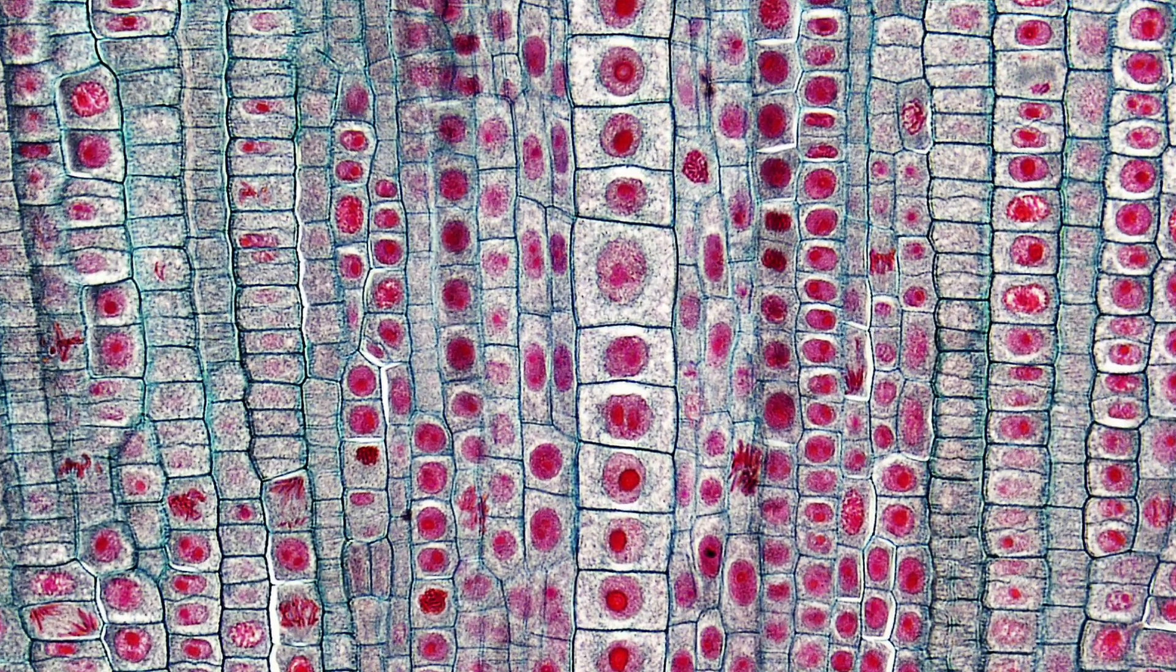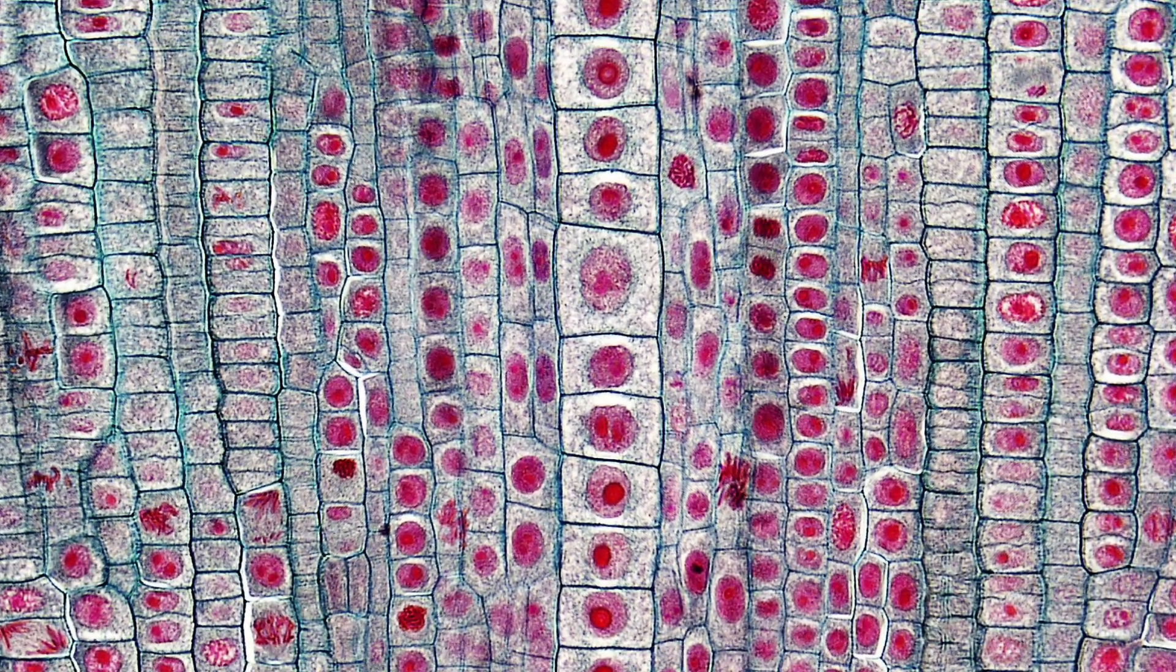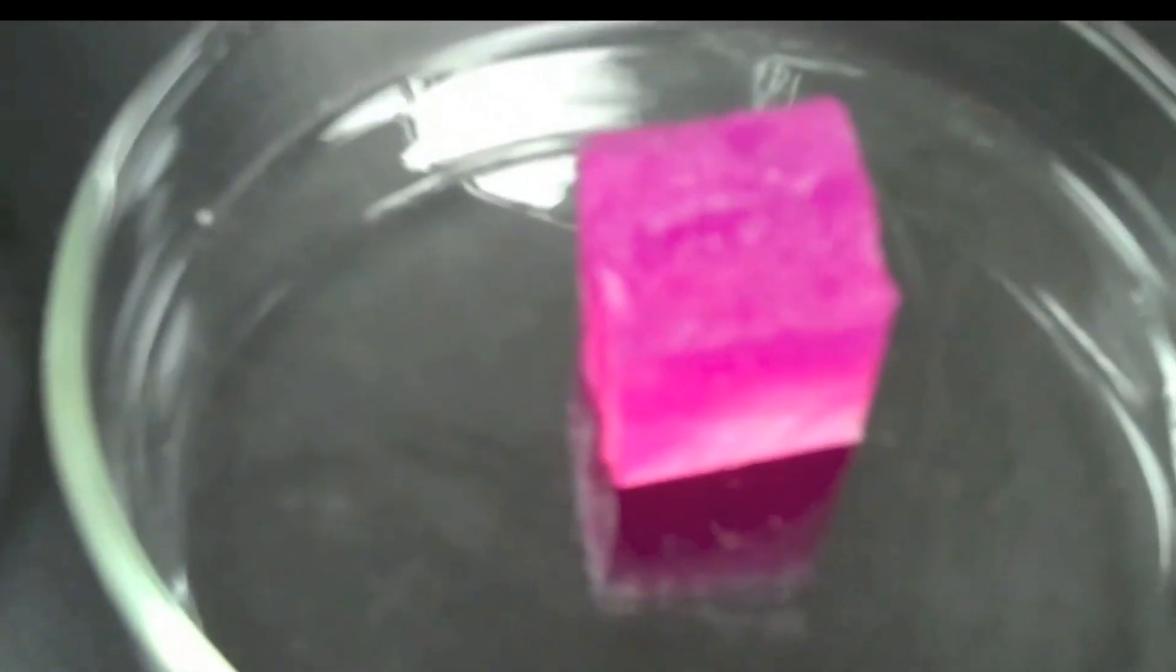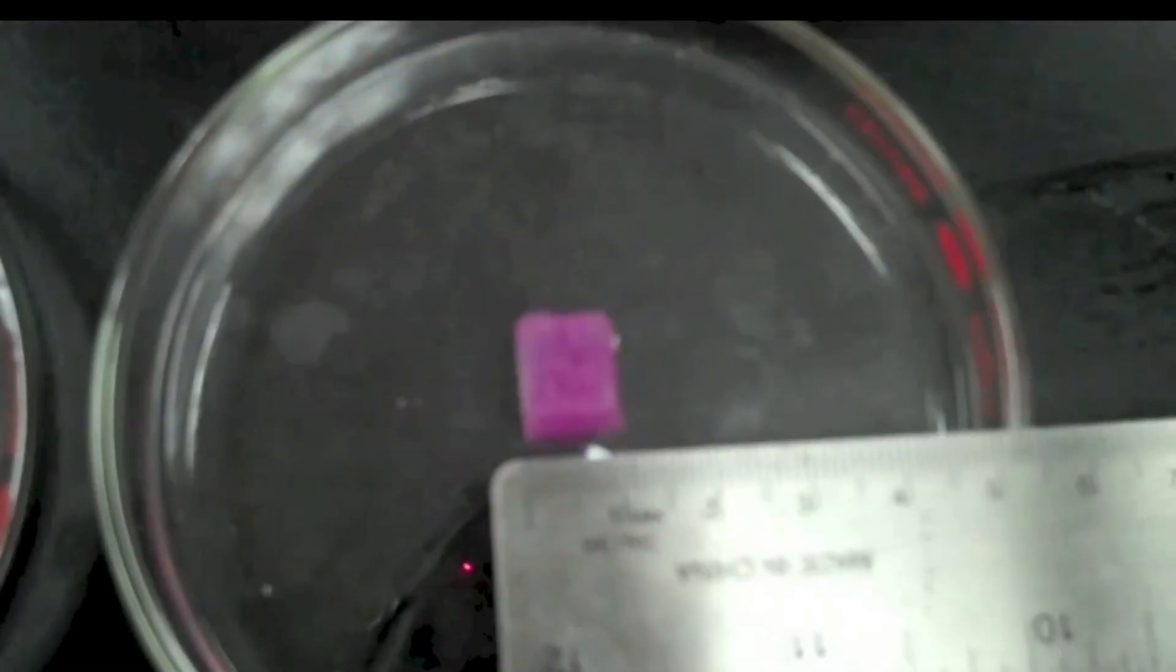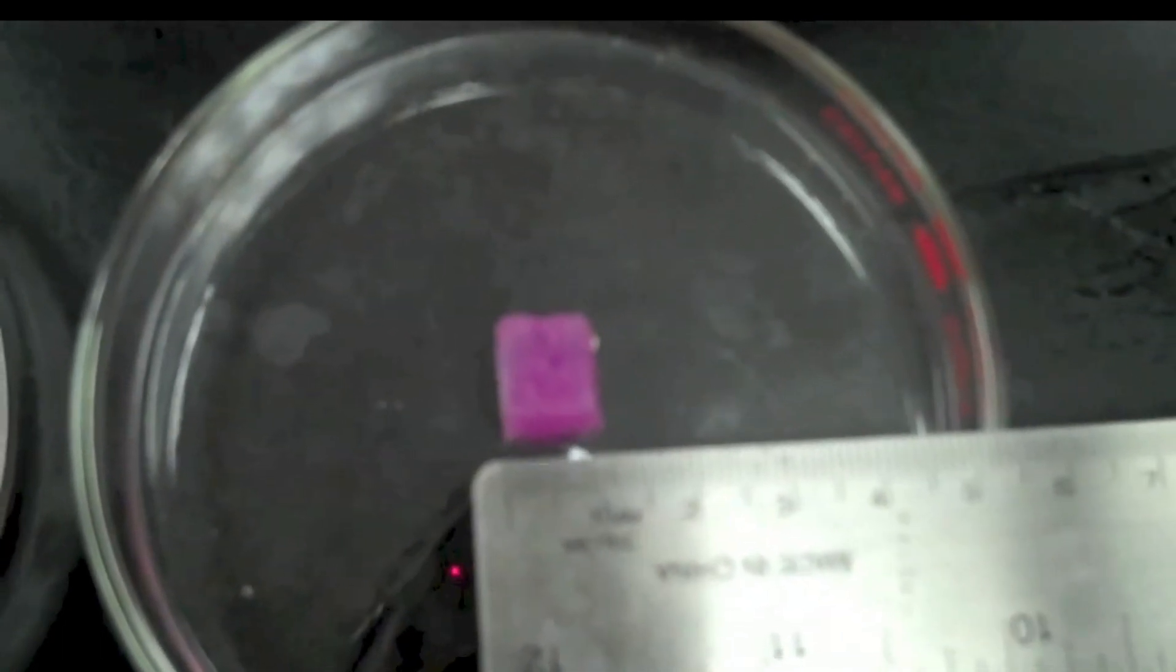A cell is a metabolic compartment where many different chemical reactions occur. In this demonstration the cell is represented by cubes of different sizes. The larger the volume of the cell, the larger the number of metabolic reactions that take place. Here the pink phenolphthalein indicator is used to visualize the volume of the cell.